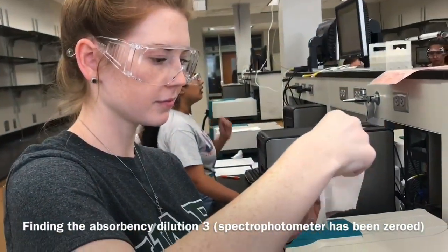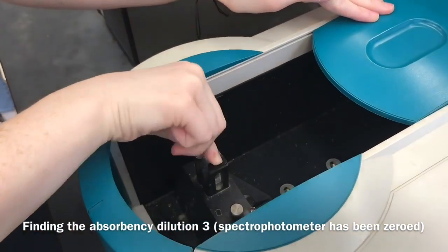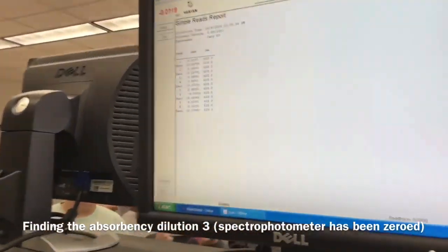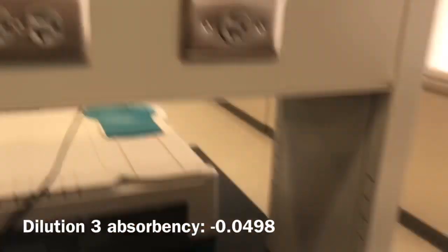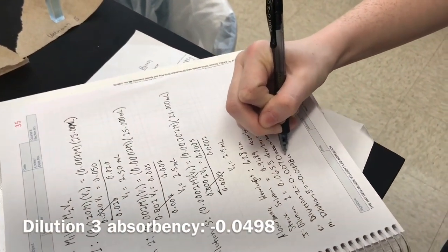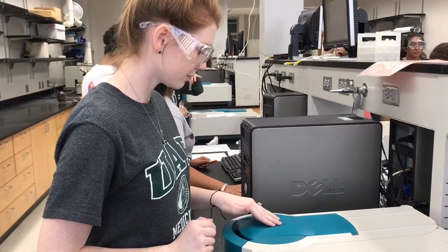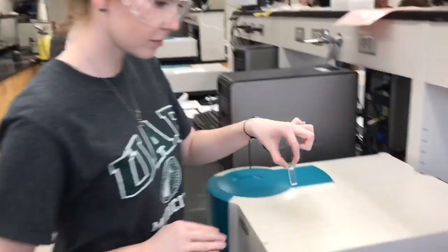Here, Morgan is properly using the spectrophotometer to find the absorbency of dilution number 3. The absorbency of dilution 3 was negative 0.0498. Here, Morgan is properly removing the cuvette from the spectrophotometer and closing it when finished.